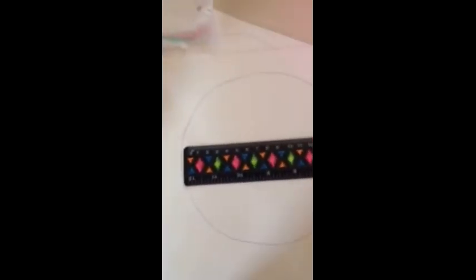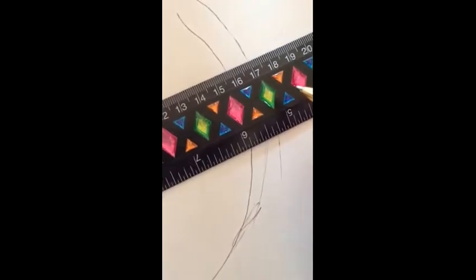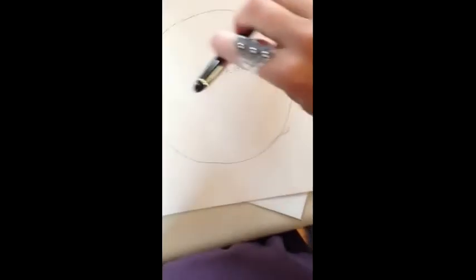And I'll show you the third balloon I measured. The third, it's the same balloon, remember, from 3 different angles. So I measured it once the long way, once the tall way, and then once at some sort of other angle to get a good representation of this volume. Okay, now this one is looking like 17.05, let's say that. Now obviously, you can see how the circle was drawn. The size of the circle will depend on the size of the balloon, of course, but also make sure when you're measuring it, your pen is straight up and down, it's not angled in, measuring the very bottom of the balloon, and it's not angled out, making the balloon look wider than it is.